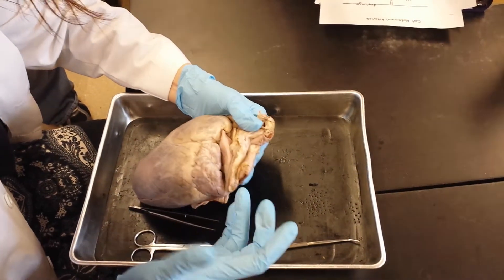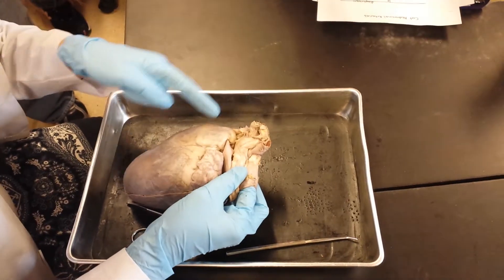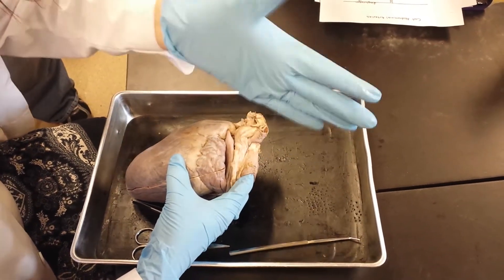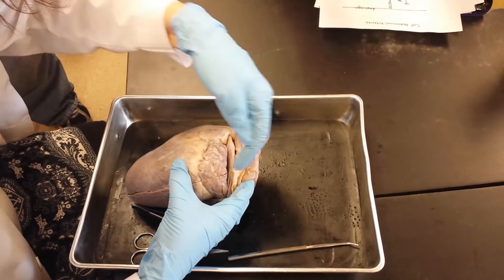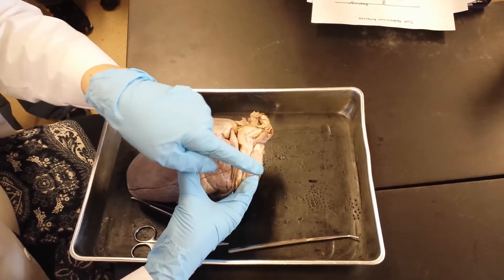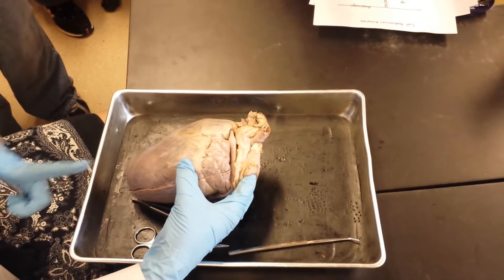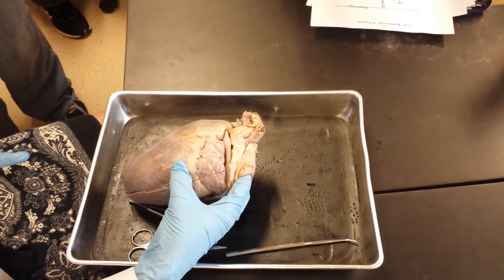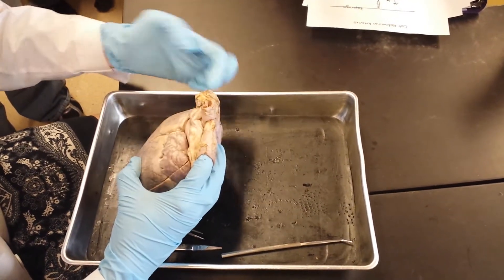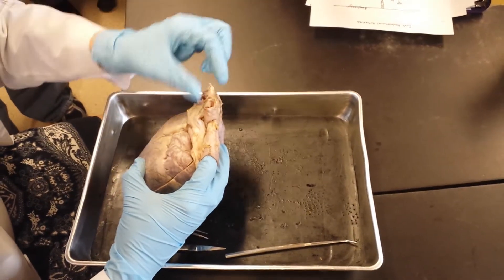On the front, I'm going to stick my right index finger in the end of the aorta. The aorta comes off the heart here and then curves around — they've cut it here and it goes through the thoracic cavity, sometimes called the thoracic aorta, then passes down through the diaphragm into the abdominal cavity, called the abdominal aorta. A lot of times the books will call this the aortic arch.